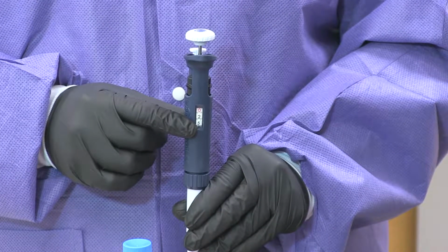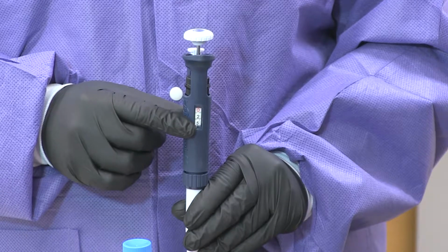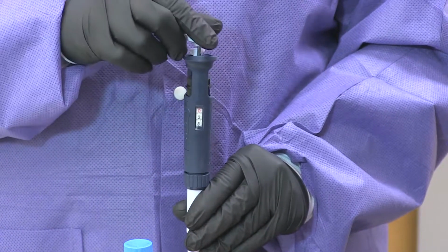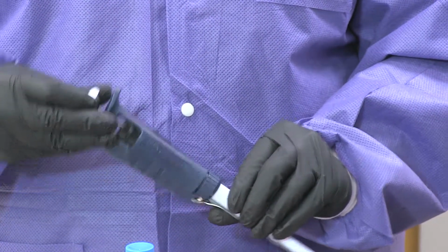Next, you're going to set your pipette. You're going to be pipetting at 0.25 mLs. You can twist the pipette to the left or to the right to set it at the 0.25 mLs. Verify that you have it set correctly before using.